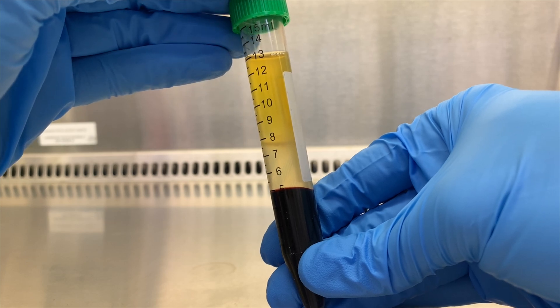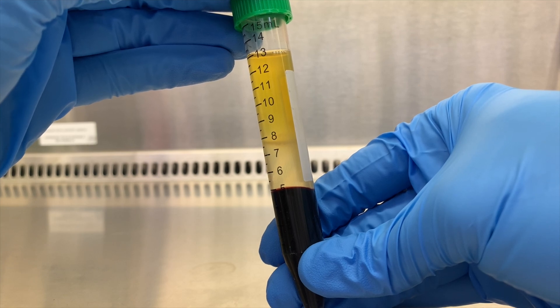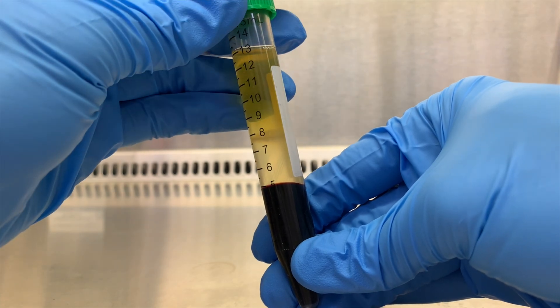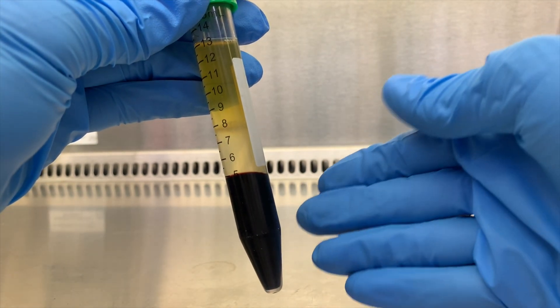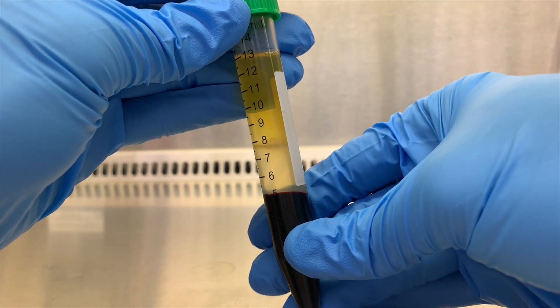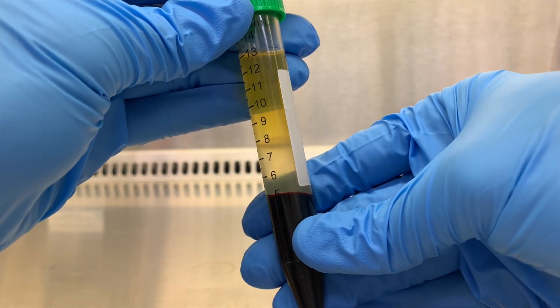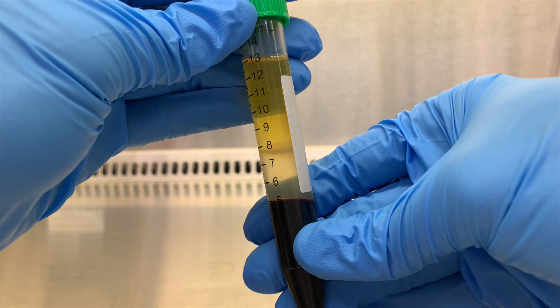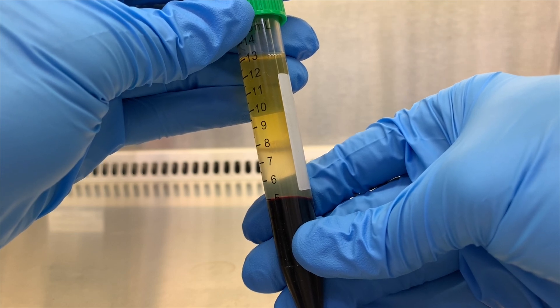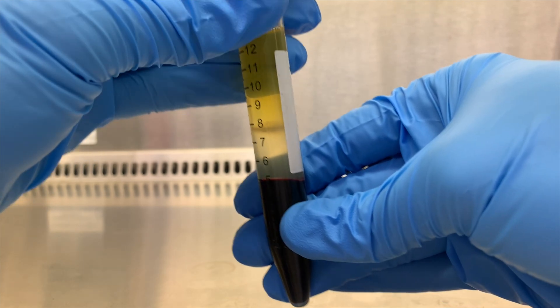Alright, let's get started with the step-by-step for my protocol, and I'll say right off the bat that your lab may use a different protocol, and they probably will, depending on what they need their cells for or what the lab has access to. My goal here is to collect PBMCs as well as plasma and keep the PBMCs as viable as I can for future processing. Your procedure might use different machines, volumes, reagents, brands, safety measures, etc. So this video is just to give you a basic understanding of the process. Always make sure you process your samples appropriately for what you need, and follow the necessary safety precautions and protocols for your lab.